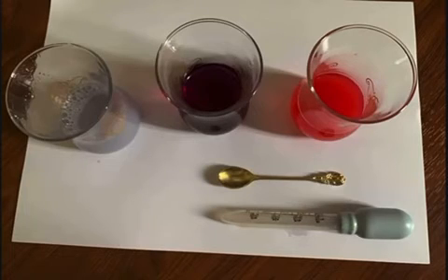By this experiment, we can determine whether any solution is acidic or basic by changing in color, but we could not determine the exact pH value of the solution. The red cabbage juice changes its color because it contains a water-soluble pigment that changes color when its hydrogen ion concentration changes, as we observed in the experiment.